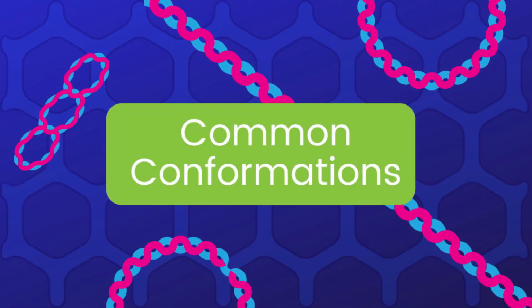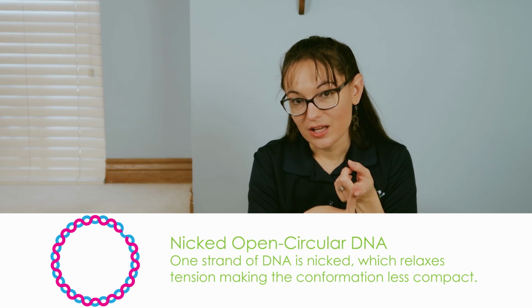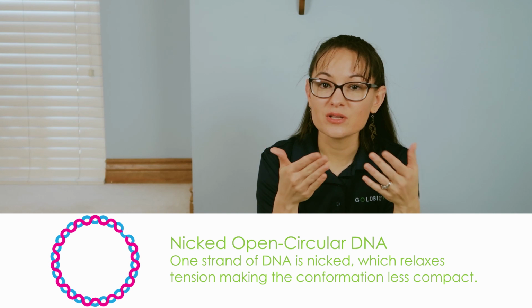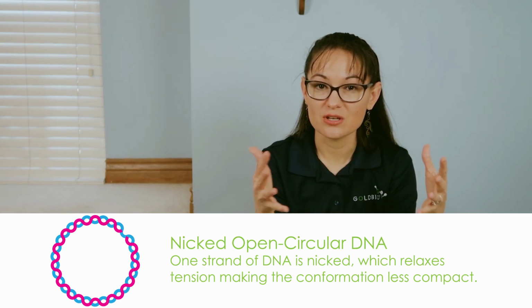Now, when it comes to answering questions about how plasmid DNA will appear in your gel, we need to look at different conformations of plasmid DNA. Though a sample of plasmid could all be the exact same size, the different conformations can actually cause them to run through the gel at different speeds. Common conformations are nicked open circular DNA, where one of the strands is cut, and this cut or nick relaxes the tension, making the conformation a lot less compact.